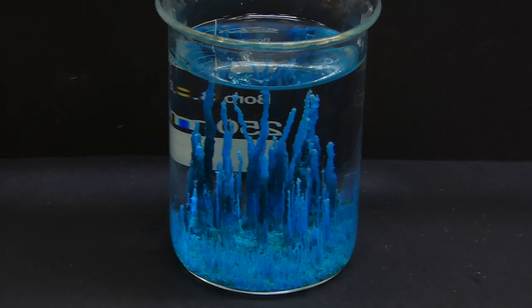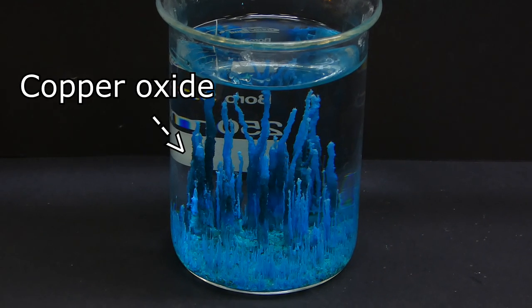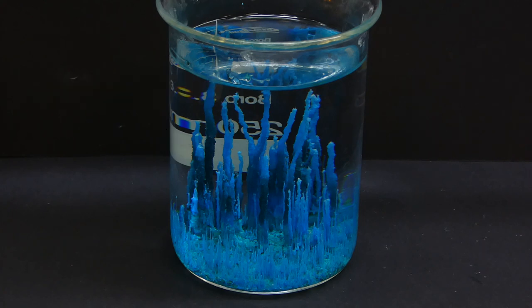The blue structures also started turning black and that's probably because there was some copper oxide forming inside them.